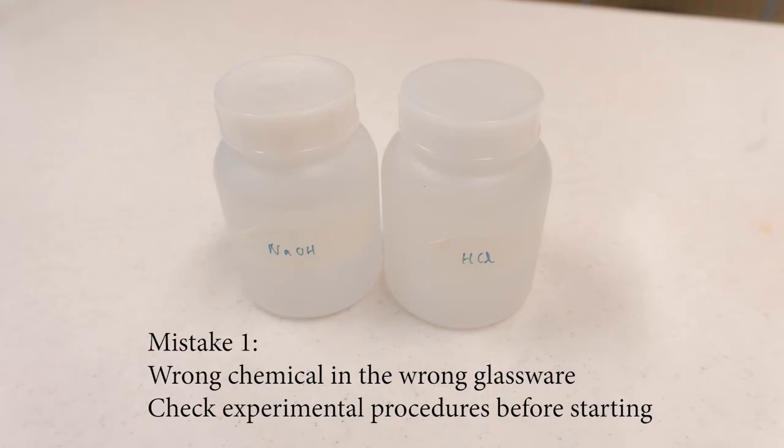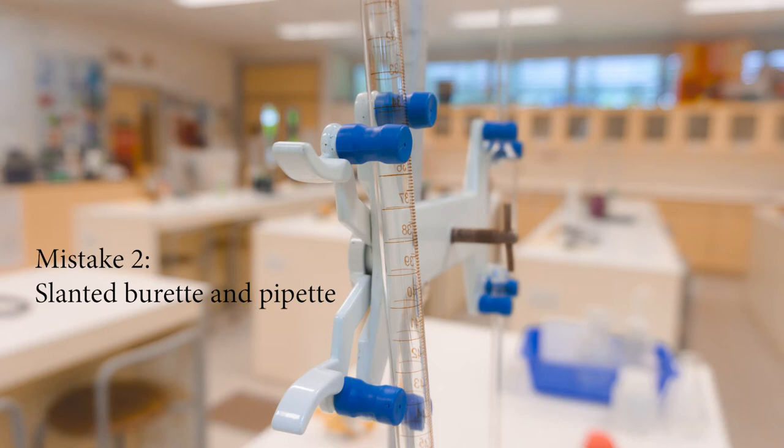in the pipette. The second mistake students often make is that the burette and the pipette are not clamped properly. This will result in the burette and pipette being slanted on the retort stand. This is very dangerous because the burette and pipette might fall off in the middle of titration and break.